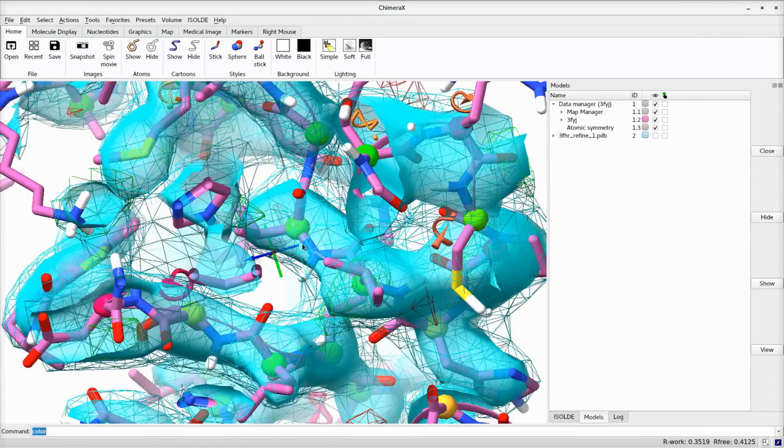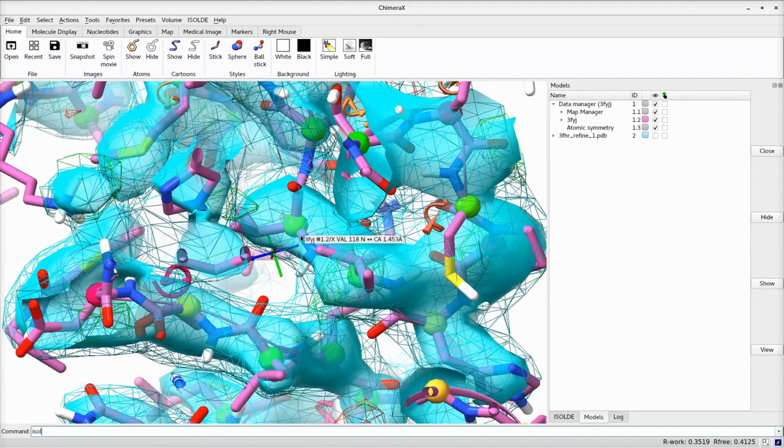Since reference models are rarely in exactly the same conformation as the model you are building, it is often most sensible to apply restraints in torsion space. In order to avoid over-restraining in the face of real conformational changes, these are implemented as top-out restraints that reduce their strength once a deviation grows too large.